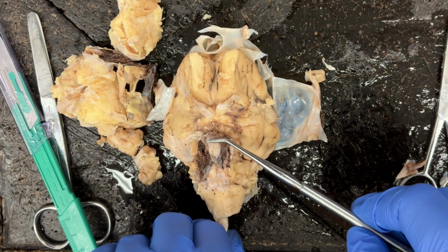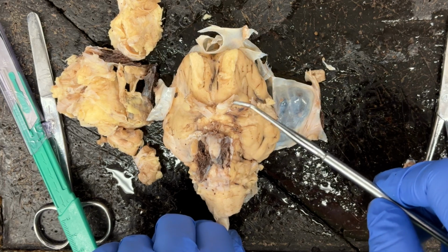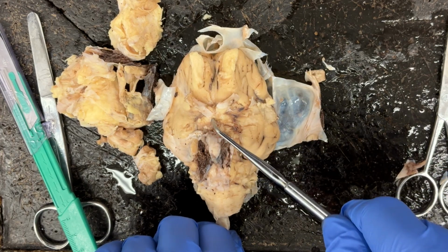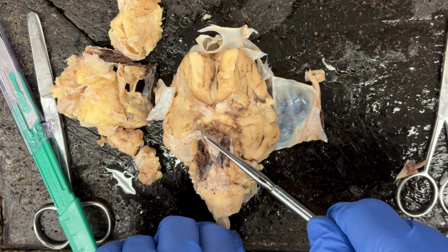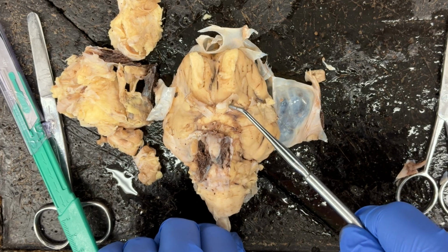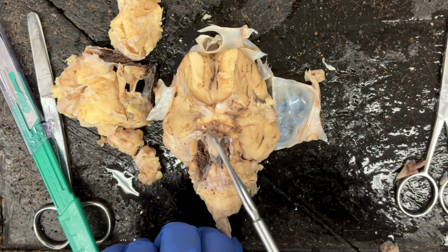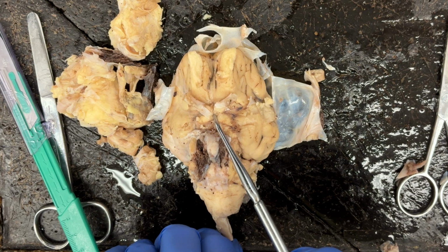Once we find the pituitary gland, if we move upwards here, then we can see the optic nerves, optic chiasma, and optic tracts. And they make kind of an X. So if you see here this X-like shape that those structures make, the optic nerves are going to be on either side here as the top part of the X. And then the bottom parts of the X are the optic tracts. And where they meet in the middle of the X is the optic chiasma.